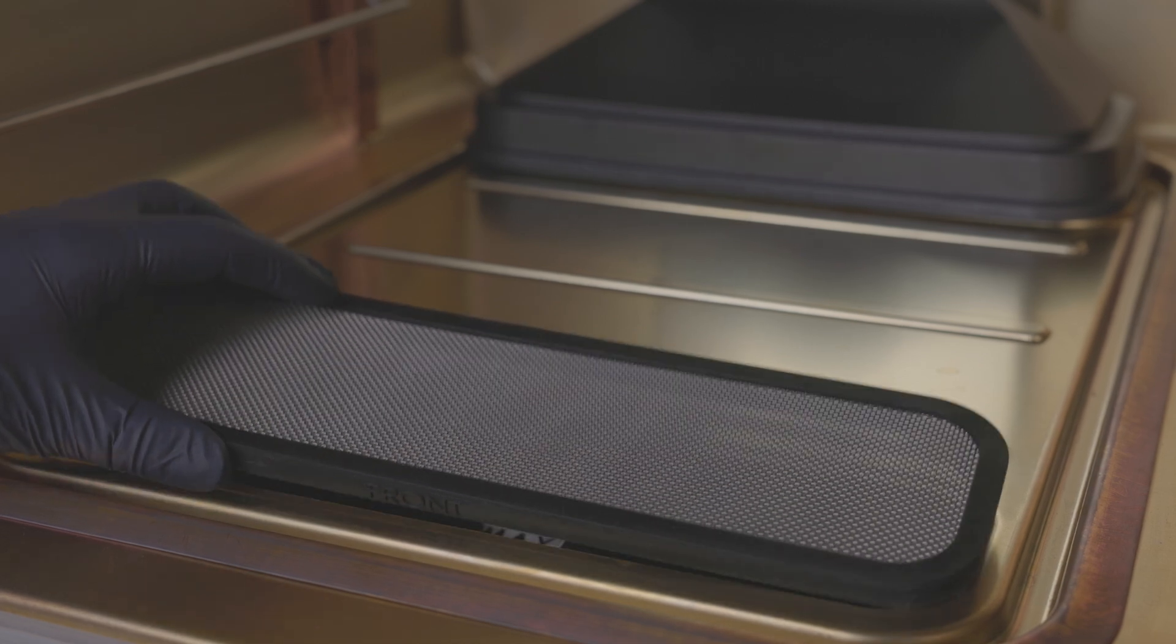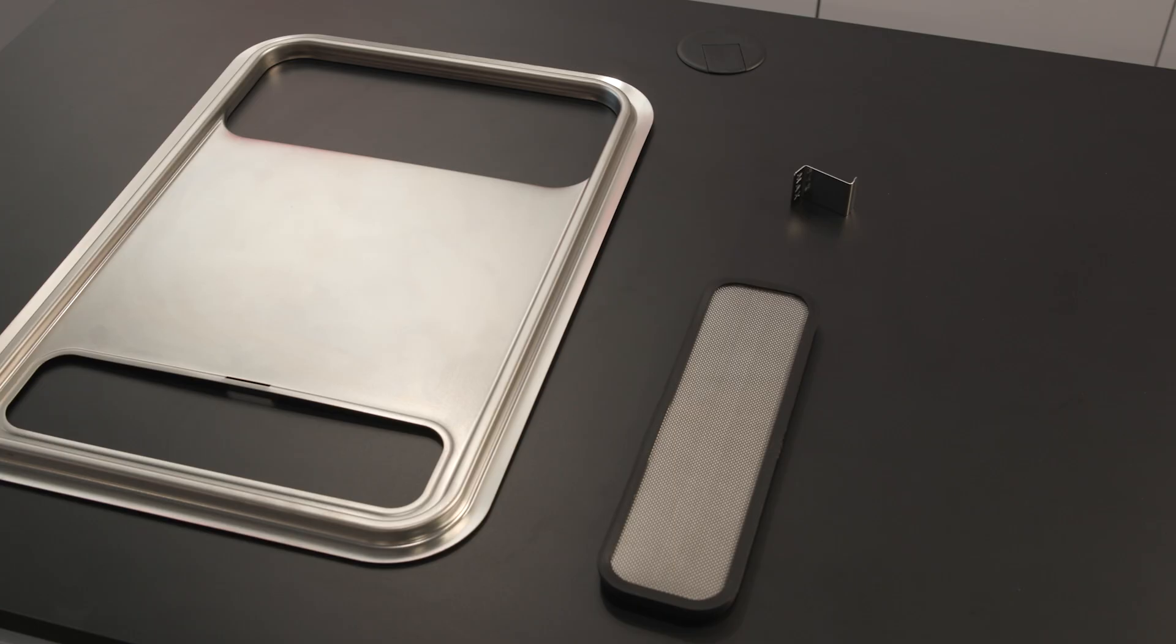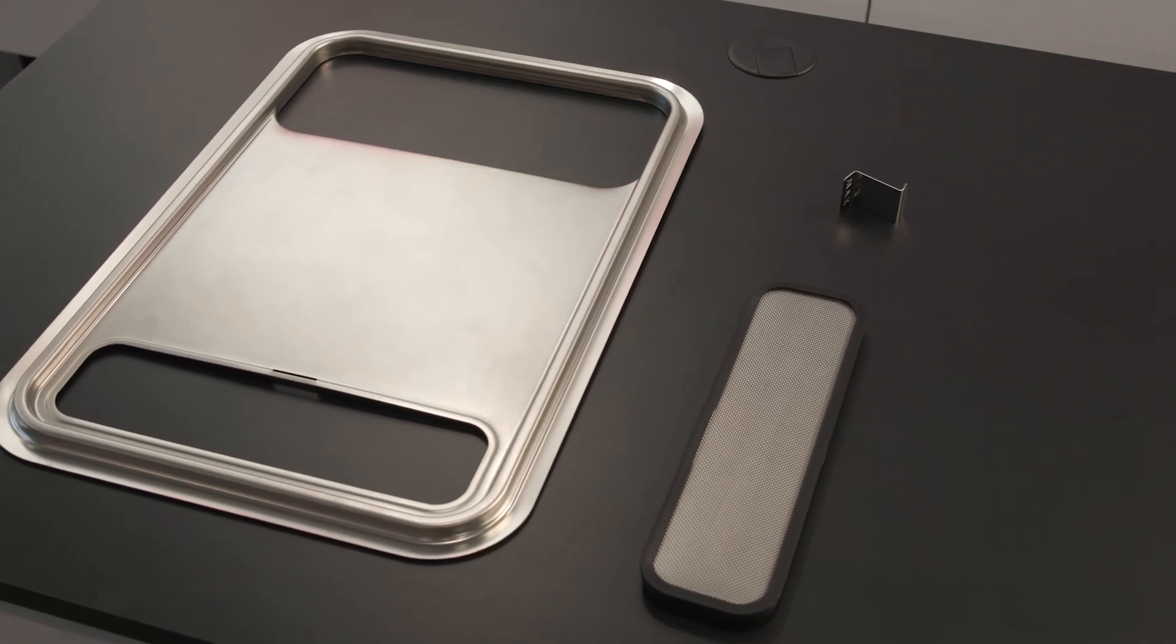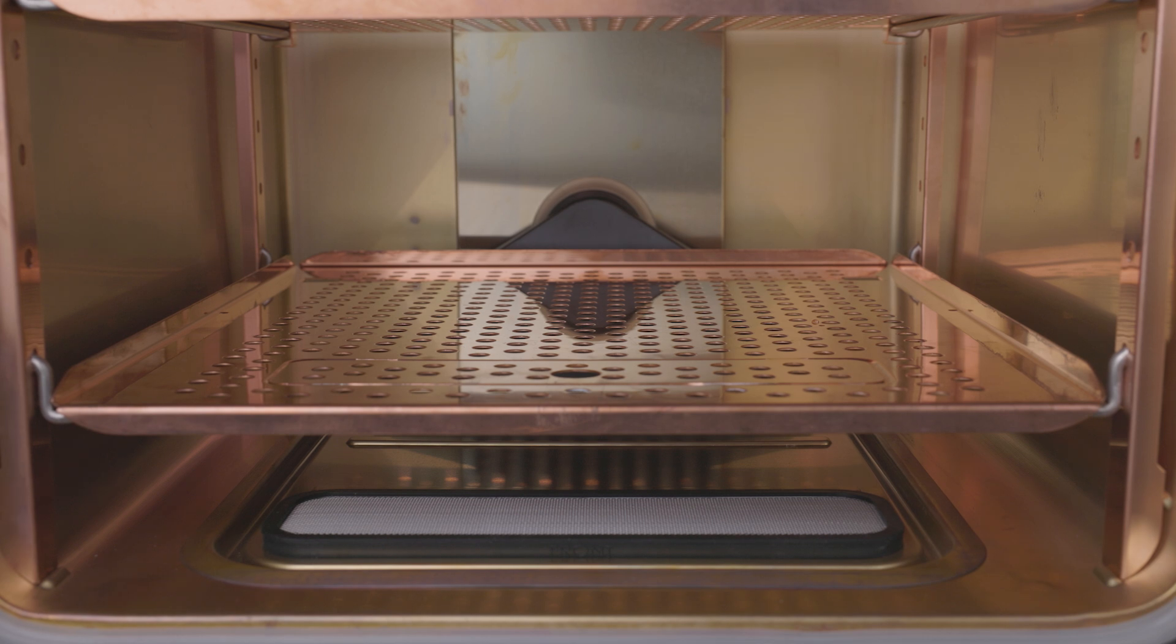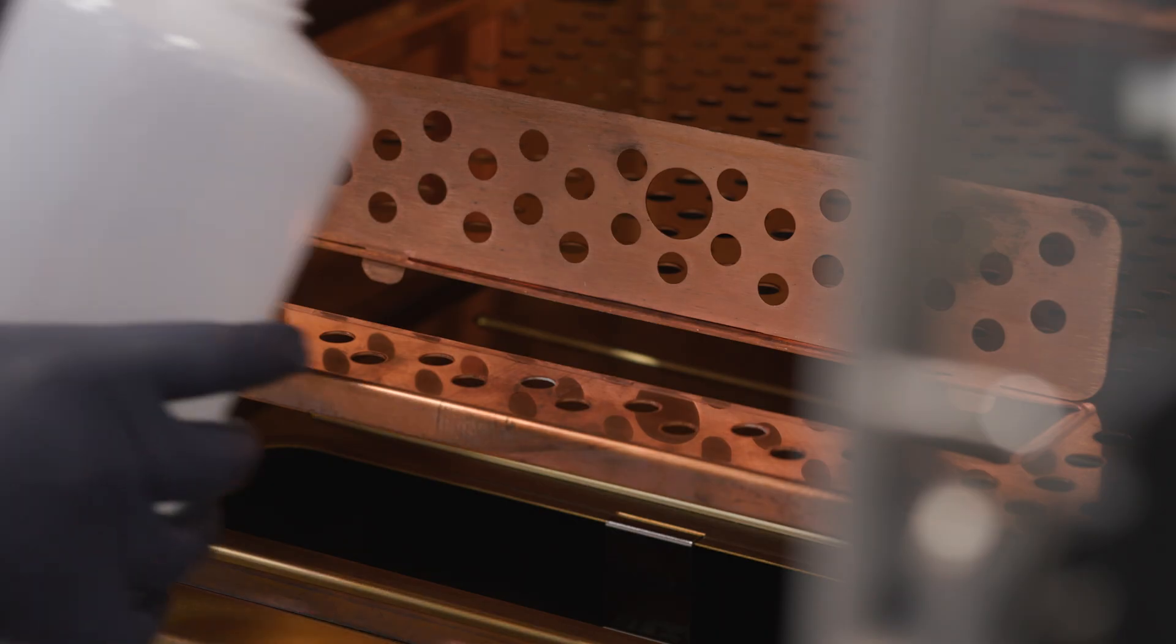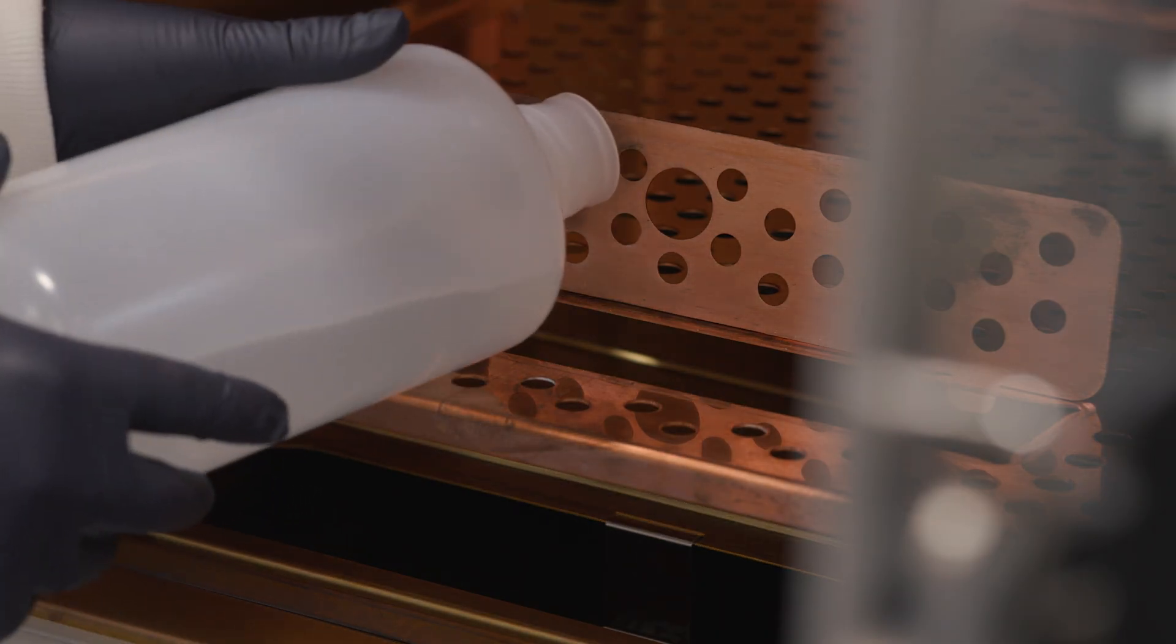The pre-filter can be found on the front section of the water reservoir cover. It consists of a dual-layer wire mesh with a silicone frame and is autoclavable as well as heat resistant. The pre-filter must remain installed in the device during the Steri-Run sterilization routine, but needs to be removed when refilling the water reservoir.